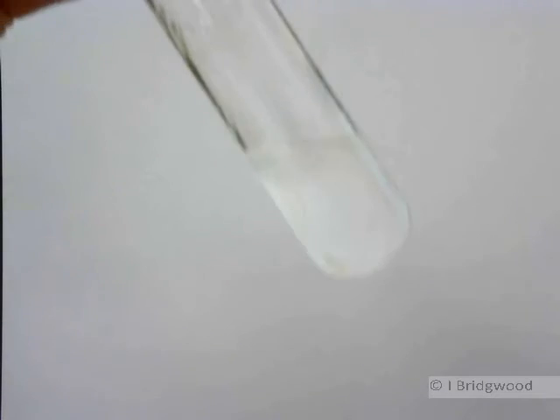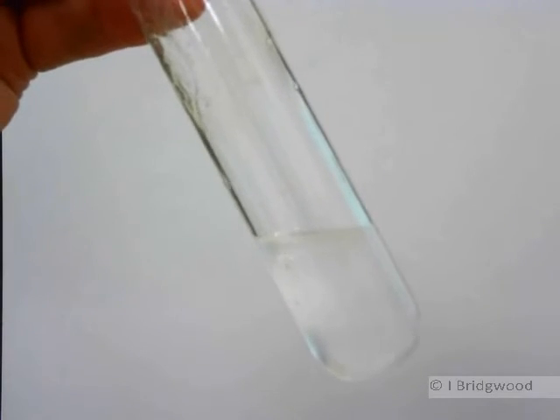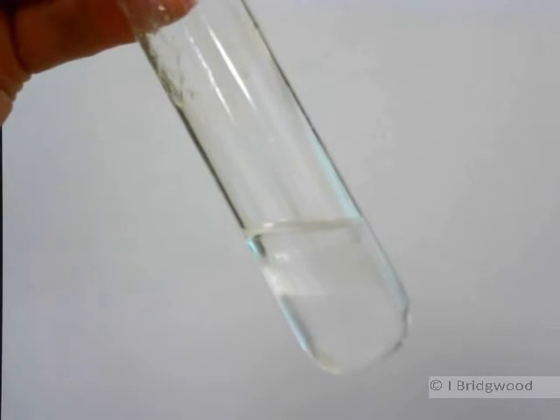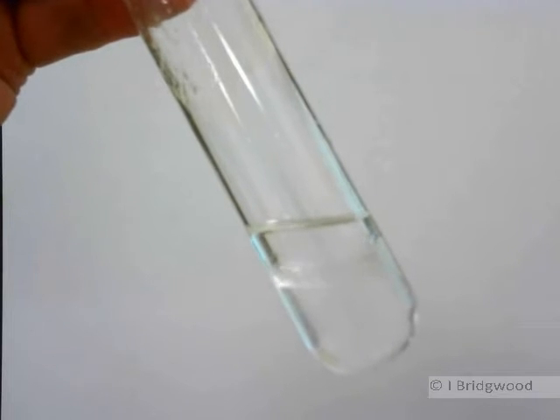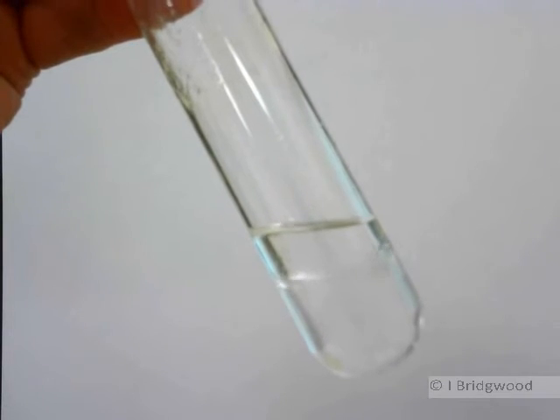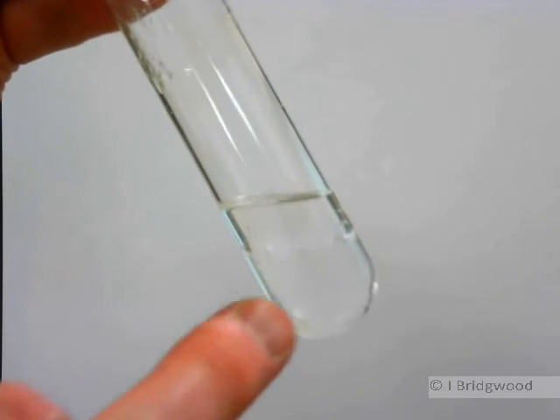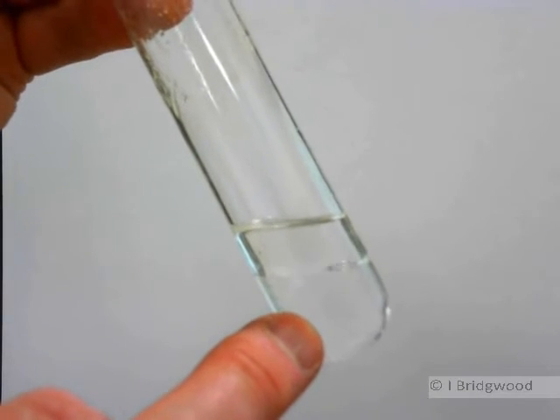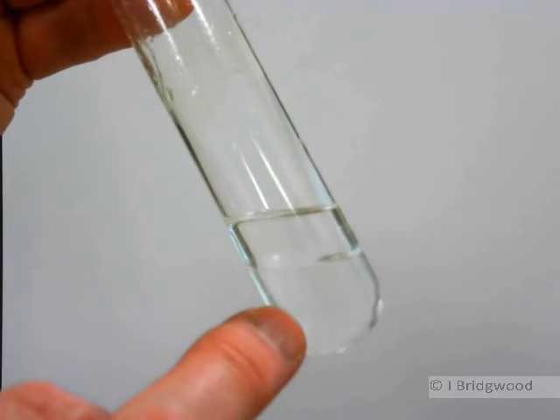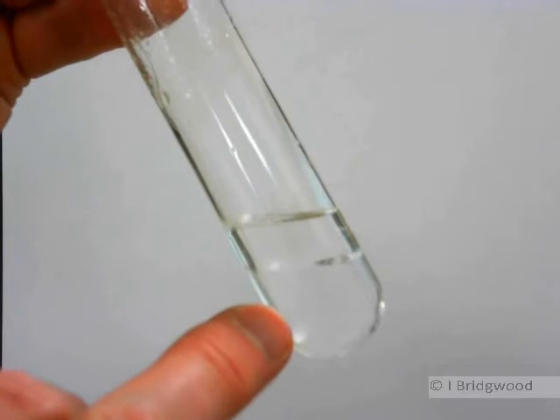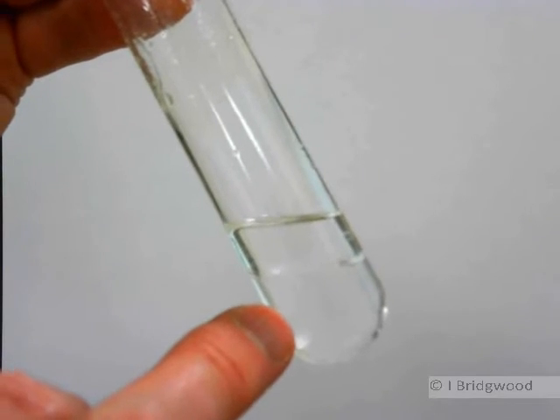And you can see that we have a bit of an emulsion. It's clearing a little bit now. And you can see that they're not really soluble. I suspect strongly that there is a reasonable amount of hexane-1-ol in the water. So it's only sparingly soluble. And you'll certainly have a little bit of water in the hexane-1-ol layer as well.